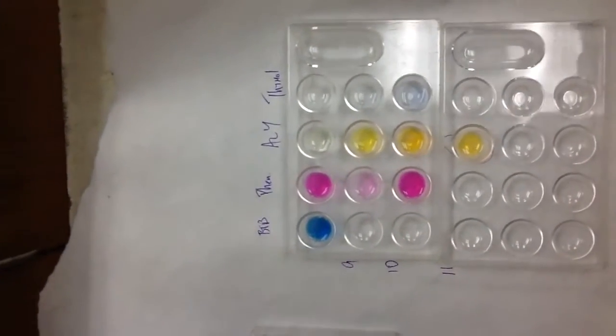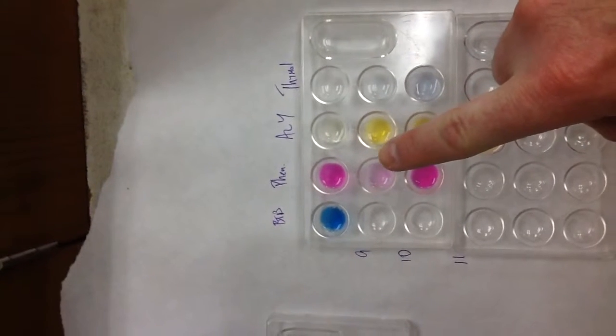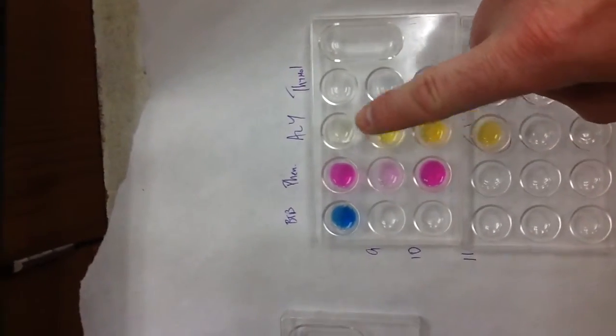I wanted to see maybe it's somewhere around 9 or 10. I wanted to see the difference. So I tested phenolphthalein, and here's my sample right there. And then this was pH 9 and pH 10. And so my sample matched 9 more. Okay. Then I went to alizarin yellow.